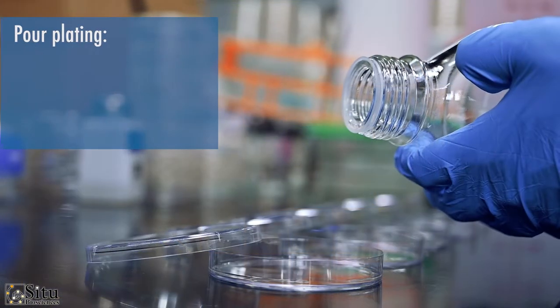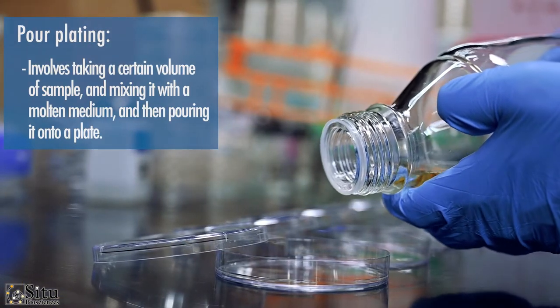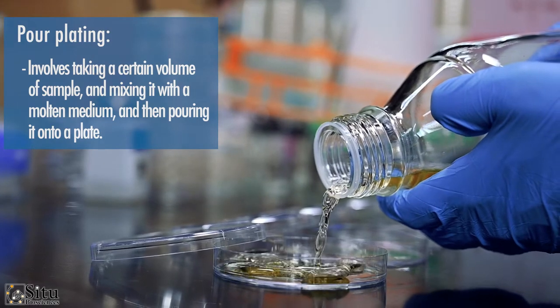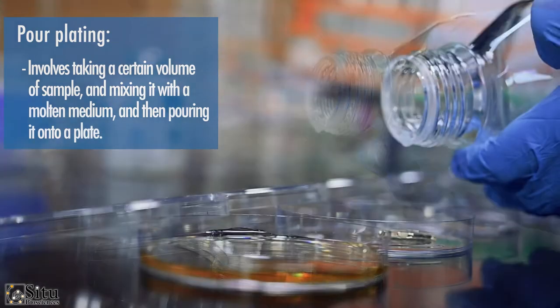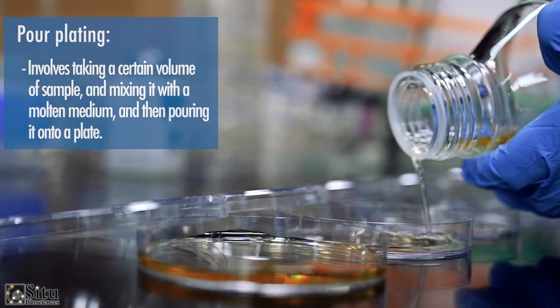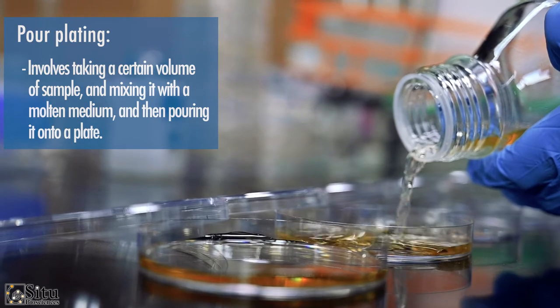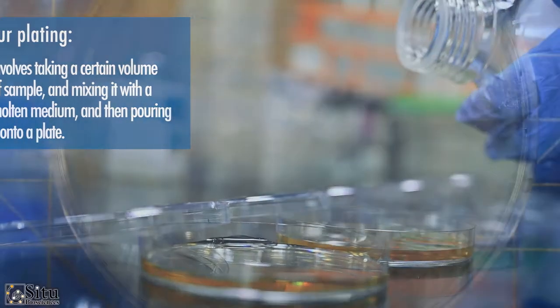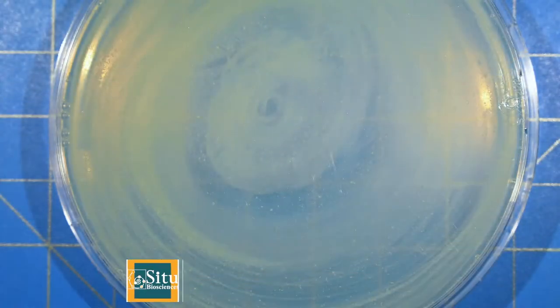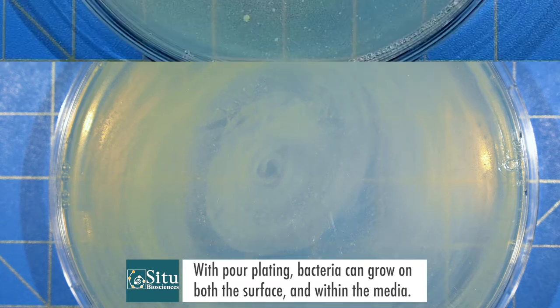The pour plating method involves taking a certain volume of sample and mixing it with the molten medium and then pouring it onto a plate. What's interesting about this method is that because of this mixing, bacteria can grow on both the surface and within the media.